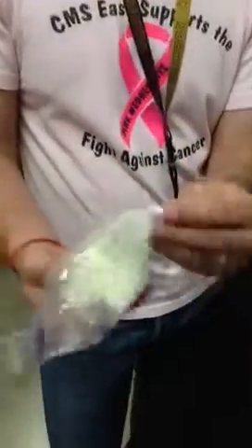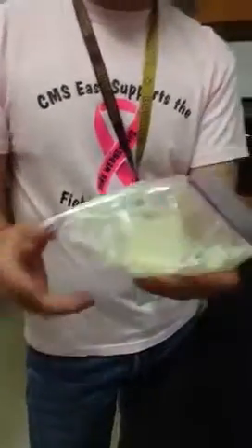All right, welcome back. We're going to mix the solutions. So we mix them both, and you should see automatically there's another color change. You should feel it, and it actually gets pretty hot. Heat is being released, and you should also see as you mix it up that the bag is starting to inflate with a gas.